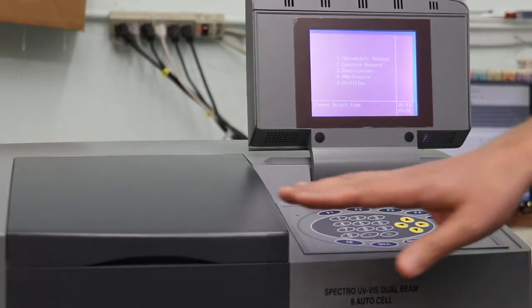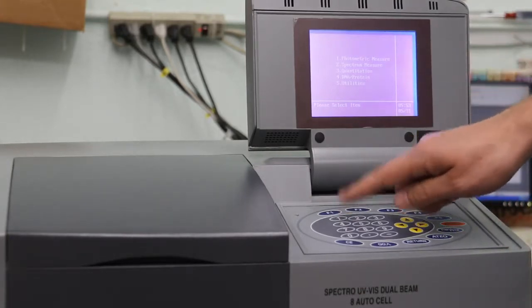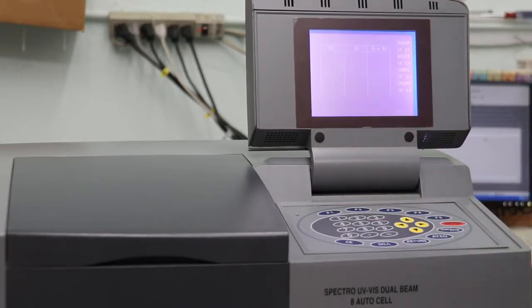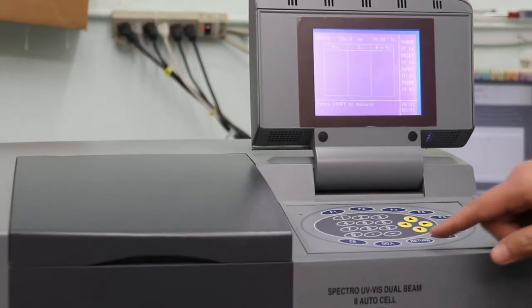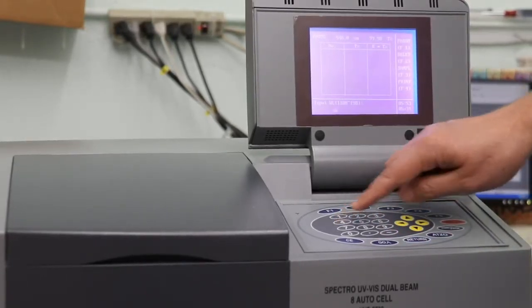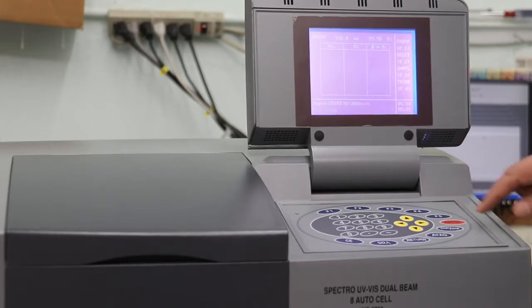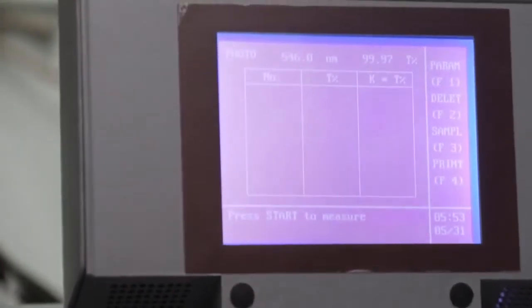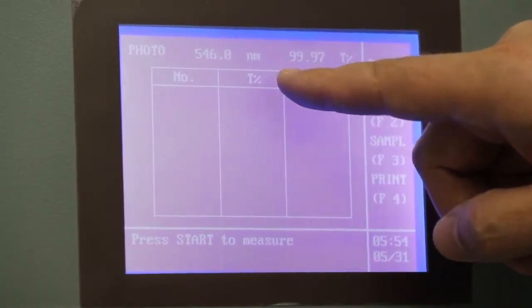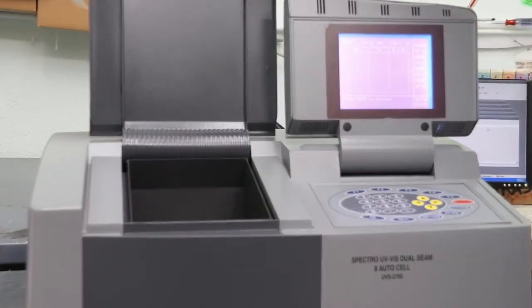To test if there's any reason why the light is not going to the sensor, go to number 1, photometric measure. To change the wavelength, press go, enter 546, and hit enter. The unit has now changed to 546 nanometers. Now we will test to see that the light is passing through to the sensor.